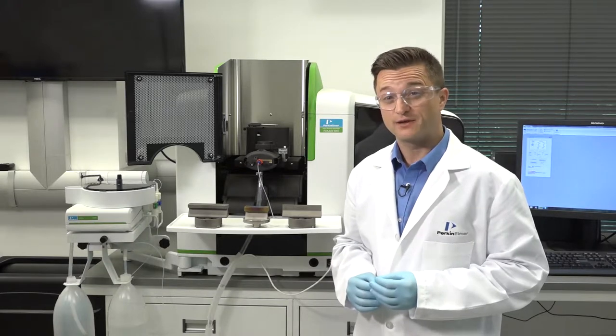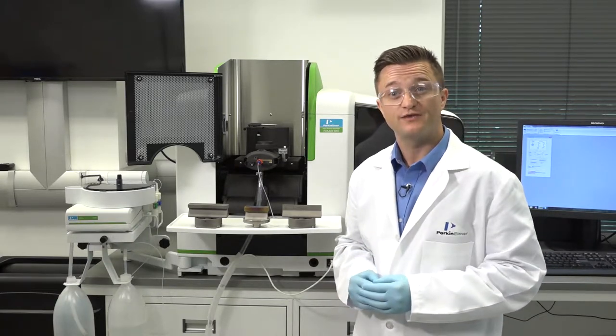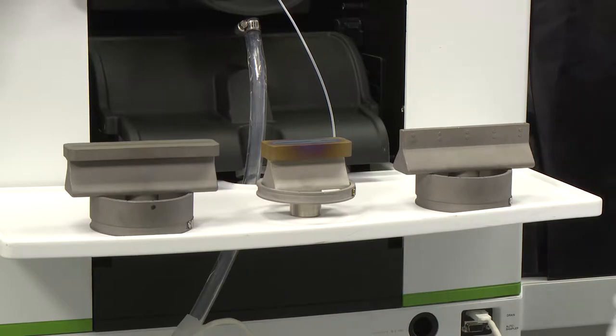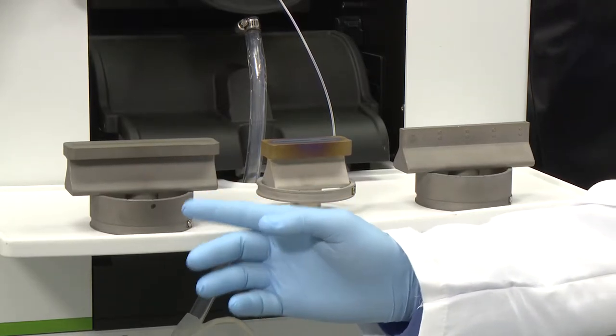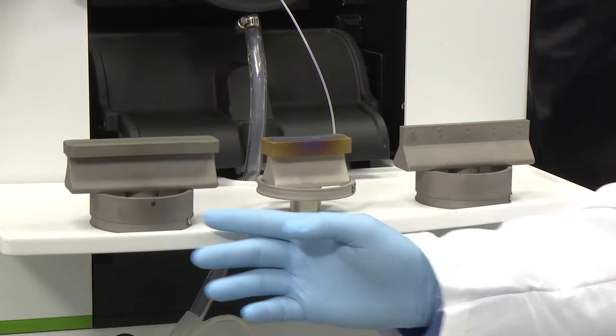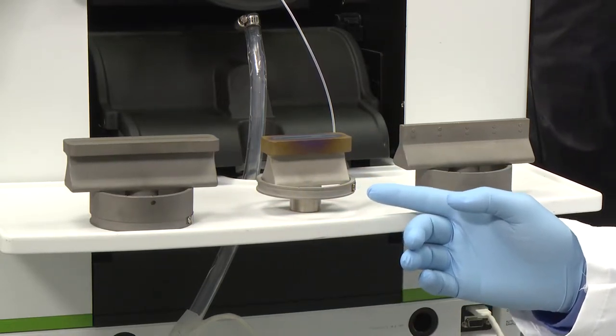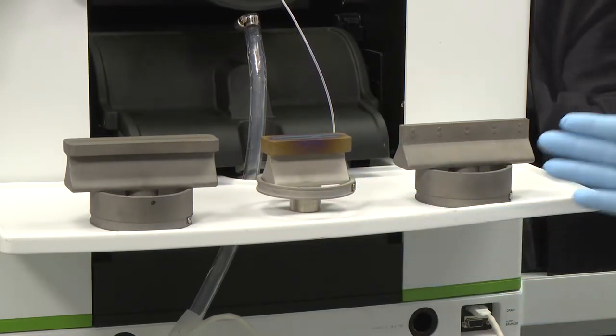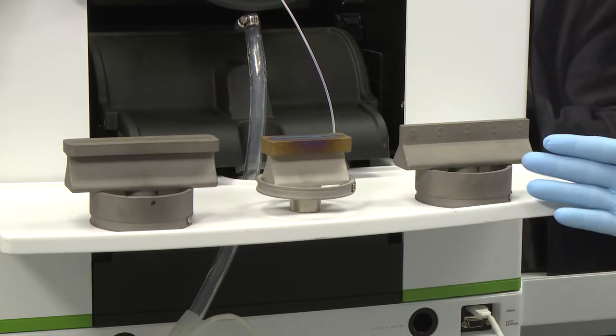Depending on your application, Pinnacle Series AA instruments provide three burner head options: our standard 10 centimeter air acetylene burner head, our five centimeter nitrous acetylene burner head, or our three slot burner head designed for high solids analysis.